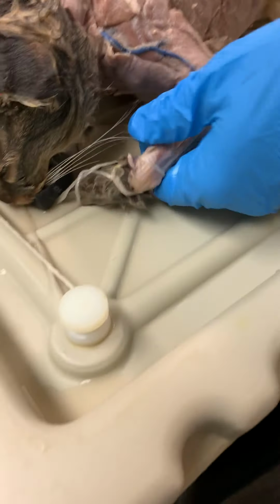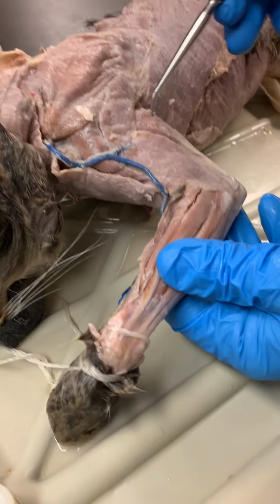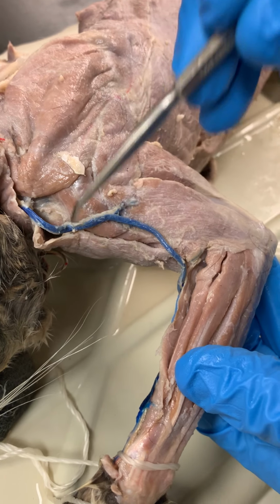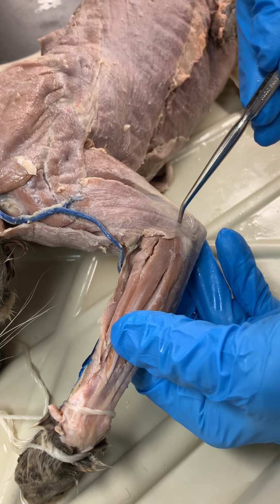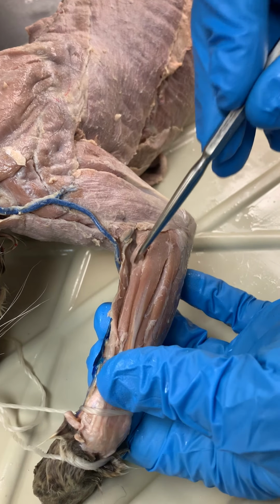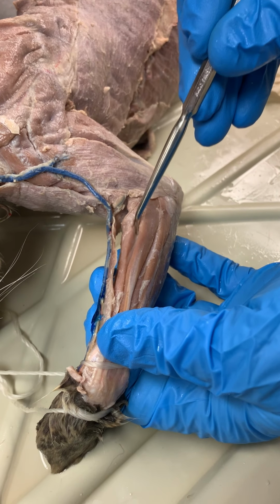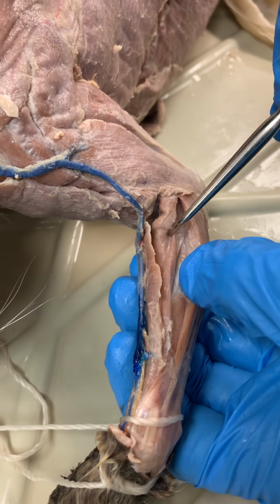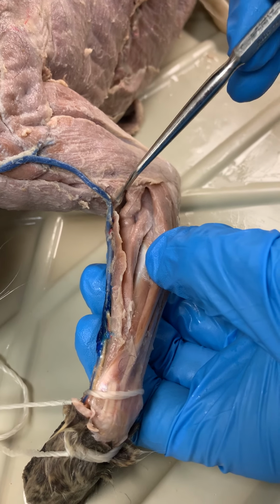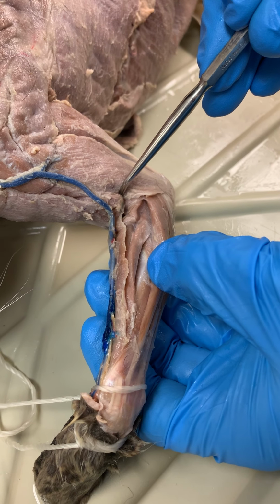All right, let's get back to the arm. I think we'll just do one side, then go to the other side and not worry too much about it. So, of course, again, reviewing clavodeltoid, acromiodeltoid, spinodeltoid. Here's your triceps, both the lateral and long head. Here we have very nicely kept brachioradialis. Here's our extensor carpi radialis. We have a long and short head, and you can just barely see the line there, but basically the long head is higher up. That's why it's long, because its origin is higher on the humerus.